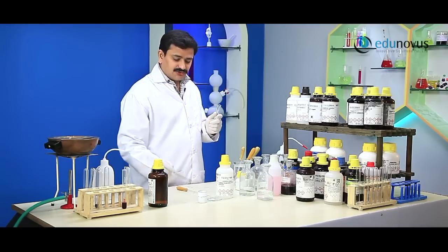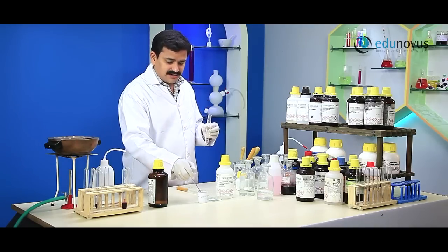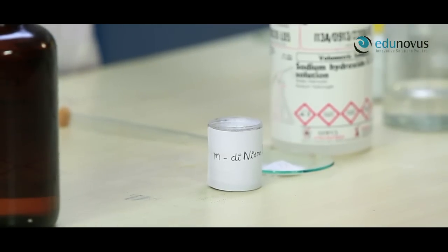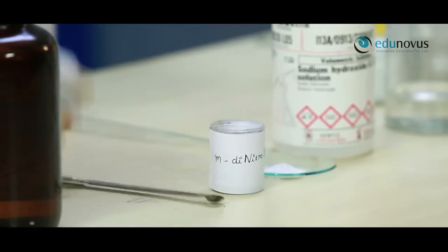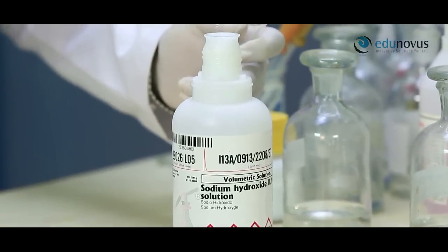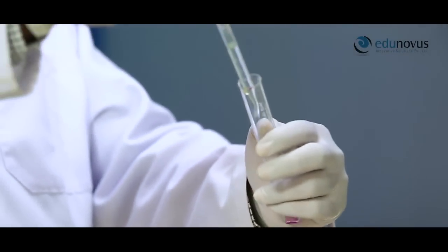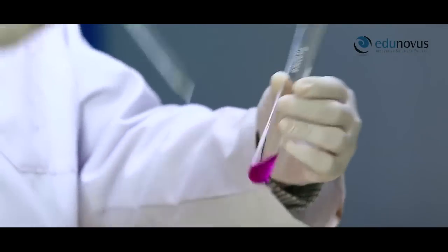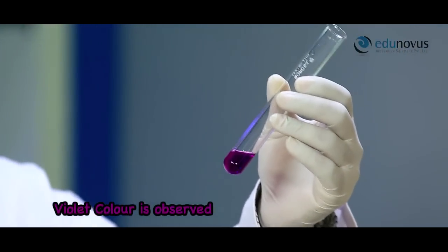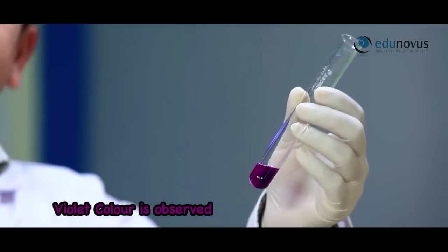In this test, to the given organic compound add a few crystals of meta-dinitrobenzene, and then add a few ml of sodium hydroxide solution. The appearance of violet colour indicates the presence of ketones. Here you can clearly see the appearance of violet colour, which confirms the presence of the ketones group.